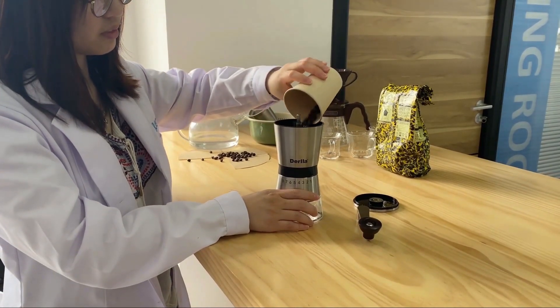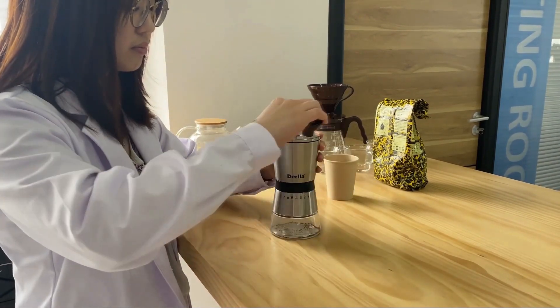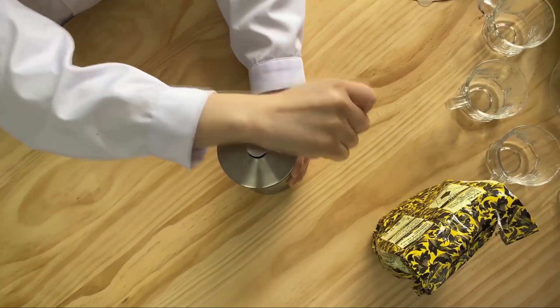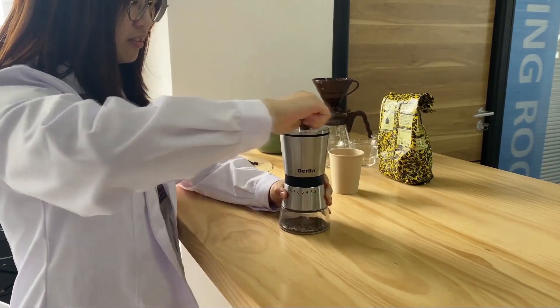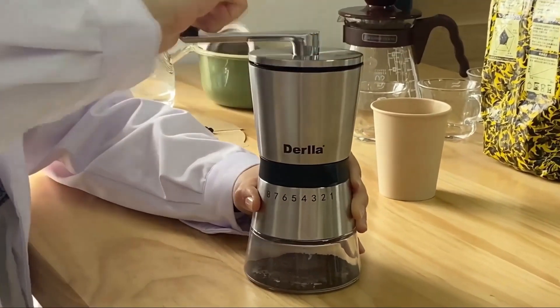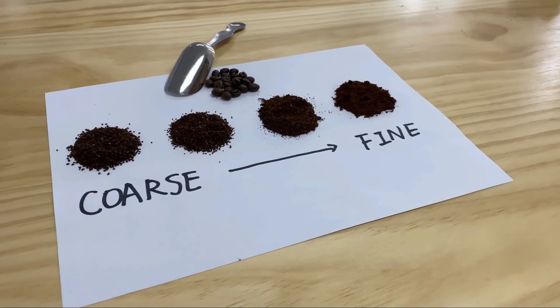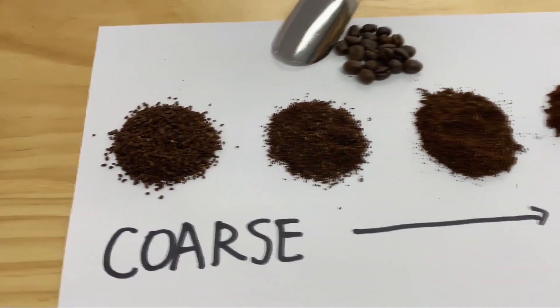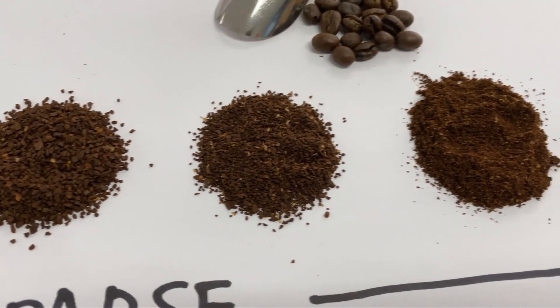Let's grind some coffee to figure out how its particle size affects its taste. We chose the roasted Arabica coffee beans from Yunnan, China to perform this little experiment. First, we will need to grind the coffee beans into different sizes using a coffee grinder. Take a closer look at the ground coffee from the grinder. We can see that different grinding settings produce coffee particles of various sizes. Divide the ground coffee into four categories according to their particle sizes — the coffee particles are getting smaller and finer going from left to right.